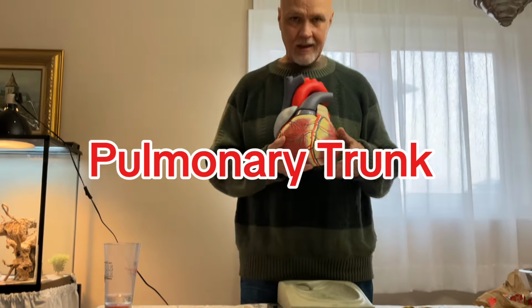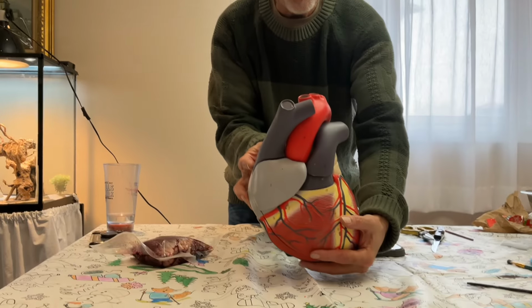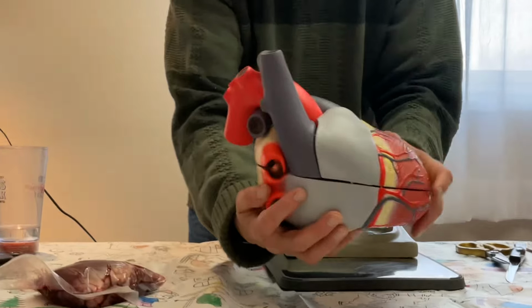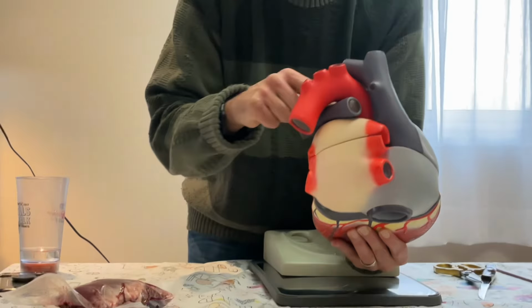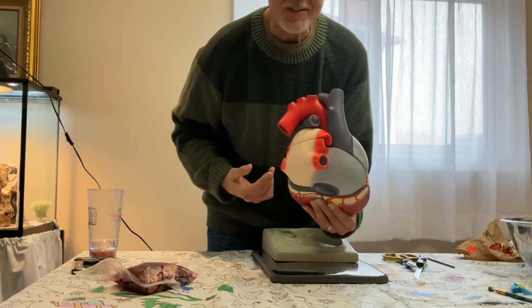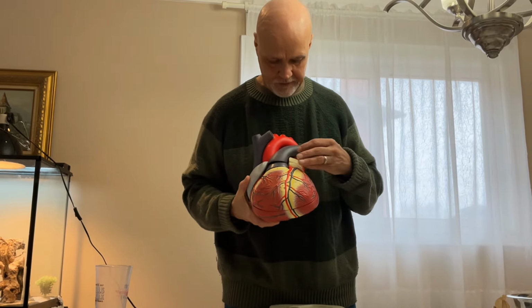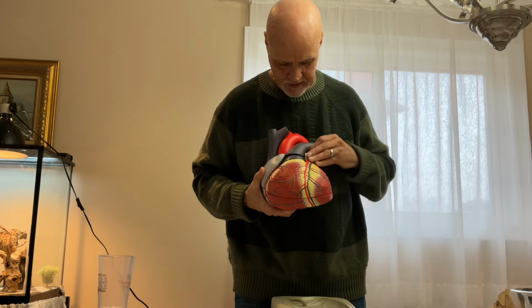And frankly, if you look at it, it kind of looks like a highway off-ramp. Look at all of these arteries and veins crossing over each other, just sort of like a highway off-ramp. It's a little bit confusing. I'm going to try and pull off vessels one by one to sort of show you what they do.